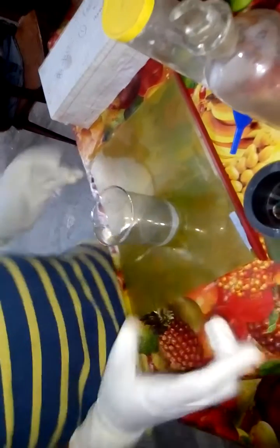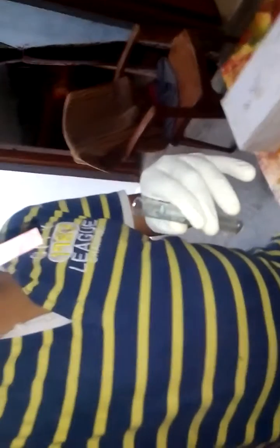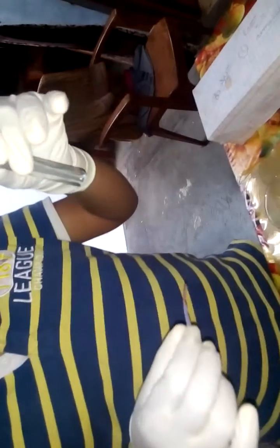So you will think how we can test it. Here I am taking my test tube. Now I am going to put my litmus that is blue. As you can see the litmus is changing into red color. It means we have an acidic solution of sodium sulfate.